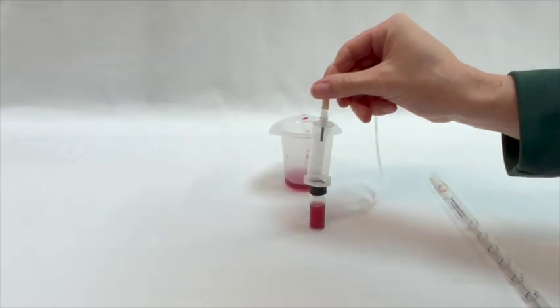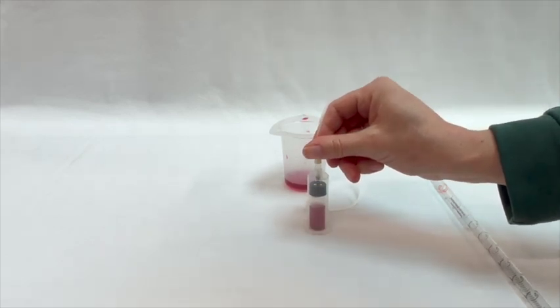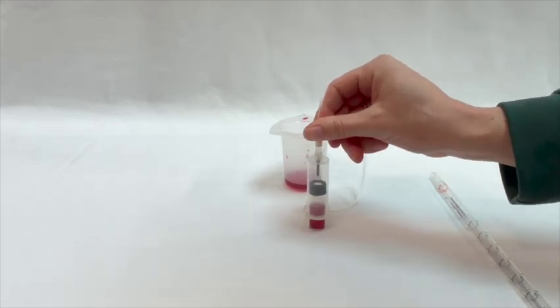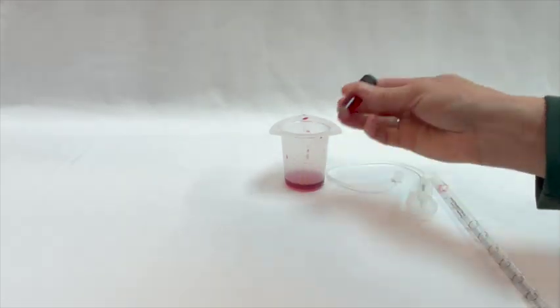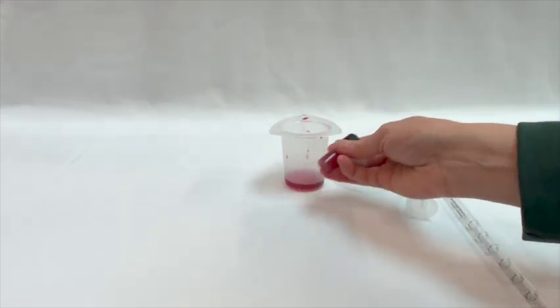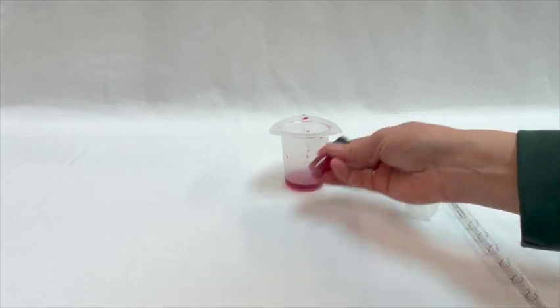And then, we are going to zero the vial using our disconnected vial insertion assembly and count to 3. Release the vial and shake for 5 seconds. Do this with all of your remaining wine samples.